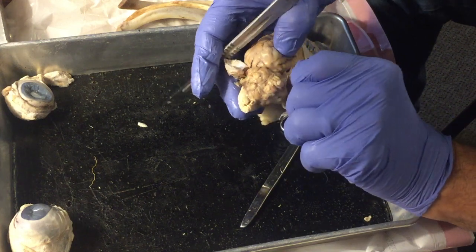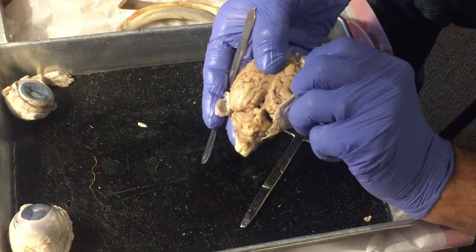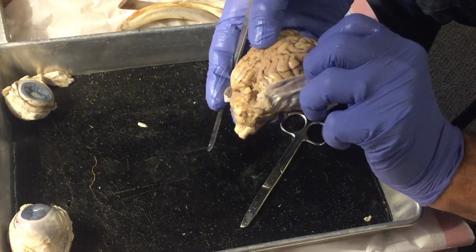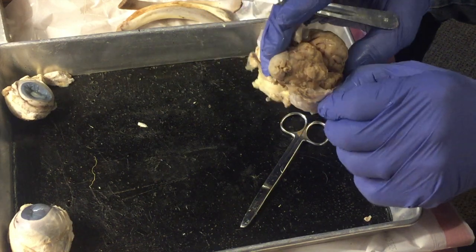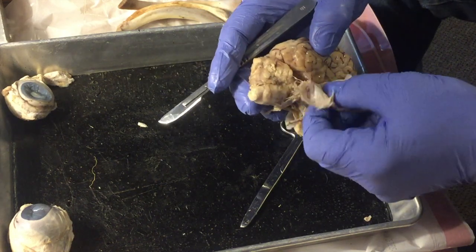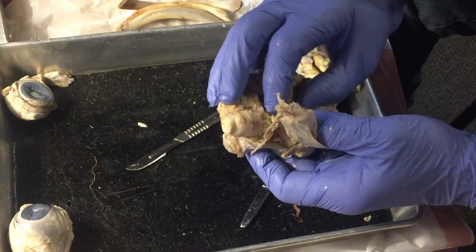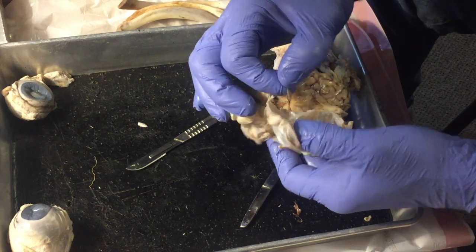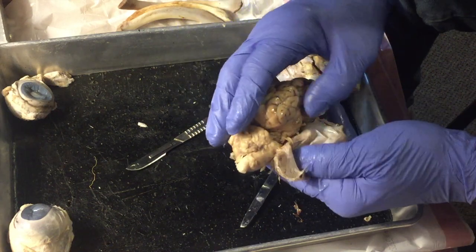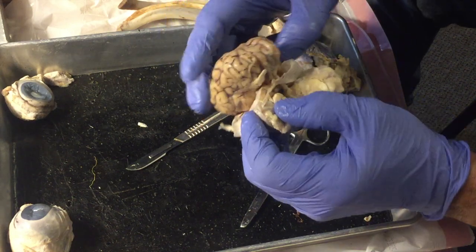So I'm going to try to pull the dura mater off the other side, and it is tough, I'm telling you. Not easy to work with. Okay, so there we're getting it off. There's the dura mater off the other side. And there are lots of nerves and blood vessels that come through holes in the dura mater as well. You see me pulling some of them loose here. You can see some more nerves down here that are coming out of the brain directly.